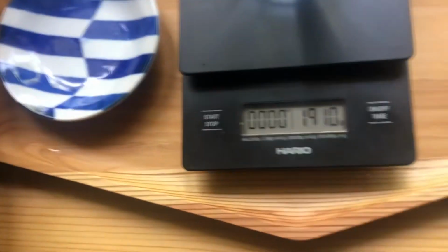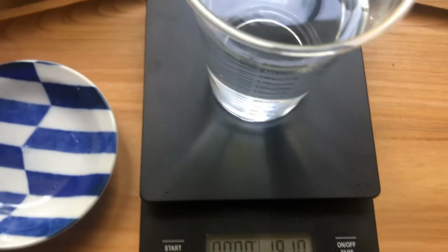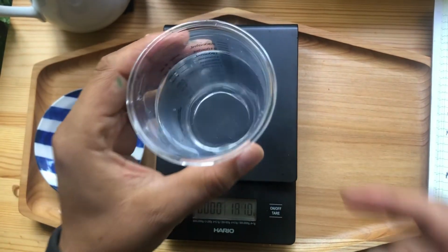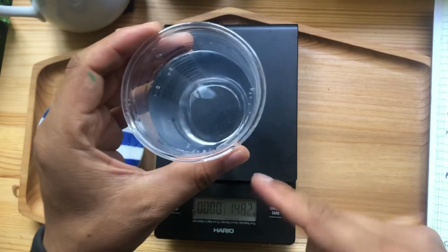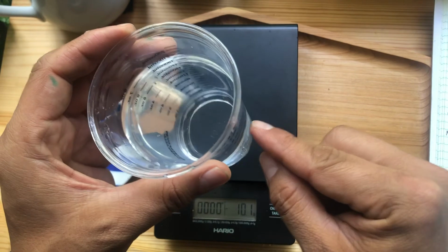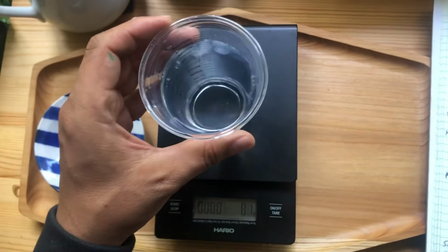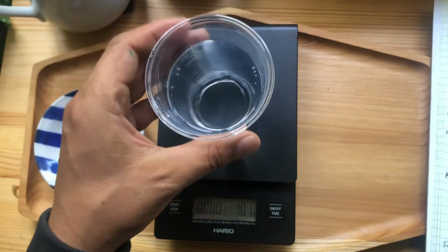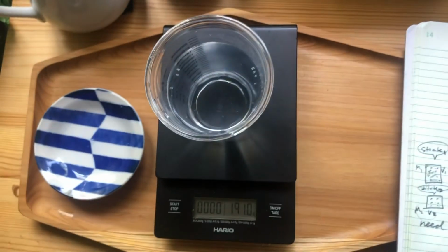So you see the balance is a little bit different, so it's probably these lines are not that accurate. A good way to do it is when you have a graduated cylinder or something like this, you can actually calibrate it with pure water. You can even turn a regular cup into a measuring cup by just adding 100 grams, 200 grams, and marking it at milliliters. So FYI. So here's my new solution. Okay, so this is my new solution at 0.100 molar, 200 milliliters.